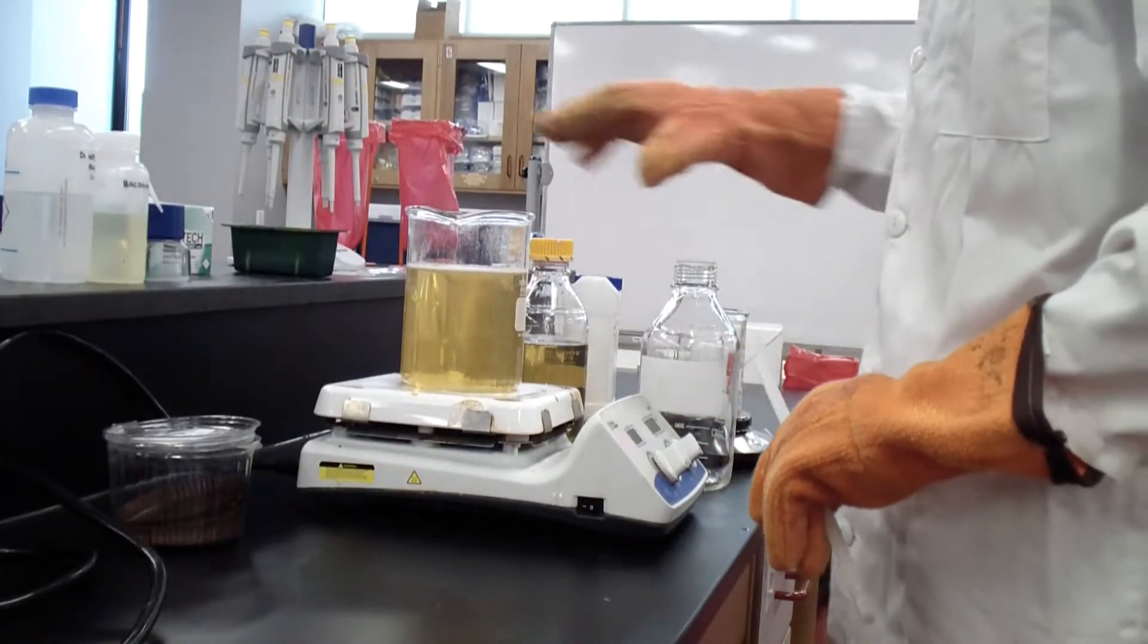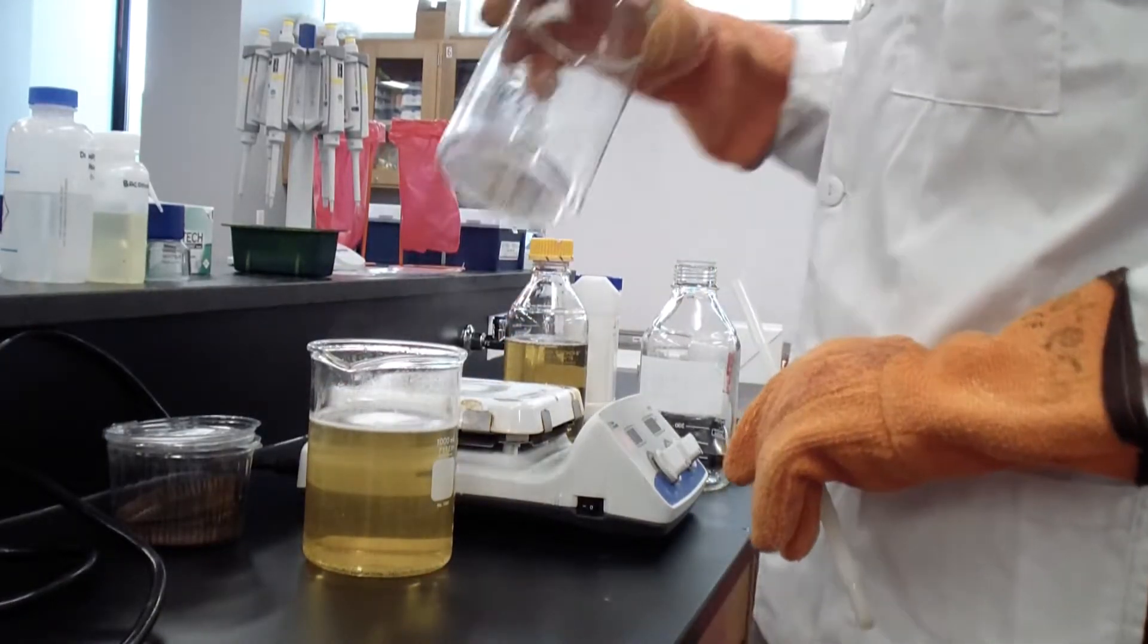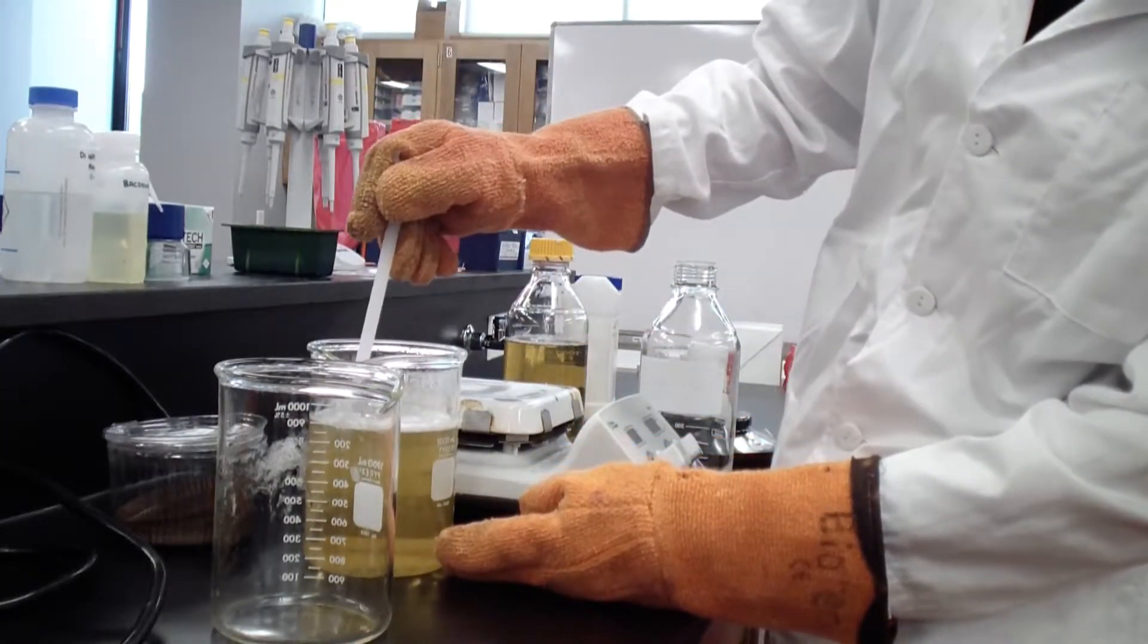Once the agar is dissolved, we remove it from the heat and we use a magnetic wand to remove the magnet.